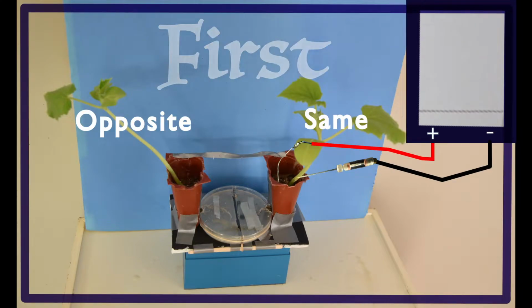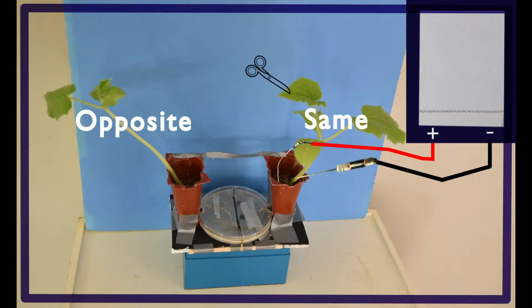We perform the testing protocol as follows to control for any artifacts in the data. We first nudge a leaf on the plant we are measuring in to see if slight vibrations in the plant will give us a response. If we get a small signal or artifact as a result of the plant moving, we attempt to better fix it in position to keep it still.